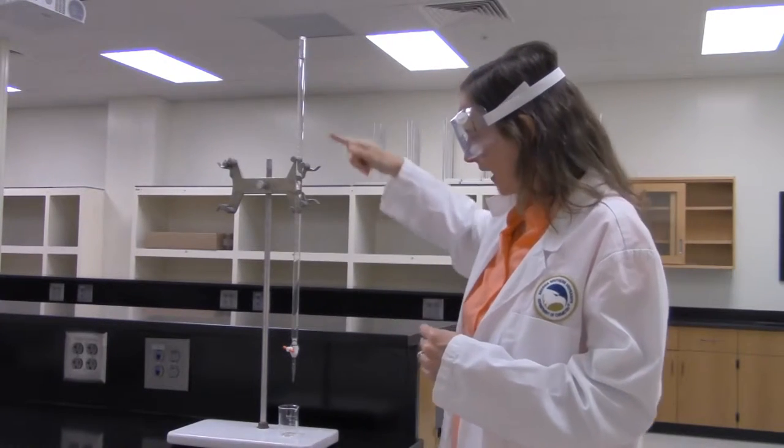At some point in the lab, you're going to be asked to measure water out of a burette. This is a burette. It's kind of an odd piece of glassware in that the very top of it here is marked with zero milliliters, and 50 milliliters is marked somewhere down close to the bottom. It has water in it now, and in order to dispense 10 milliliters from this, you just need to look at the difference in water level and get it as close to exactly 10 milliliters as you can.